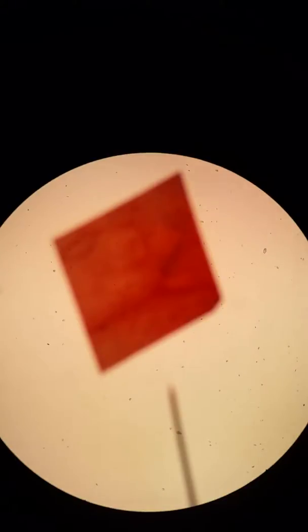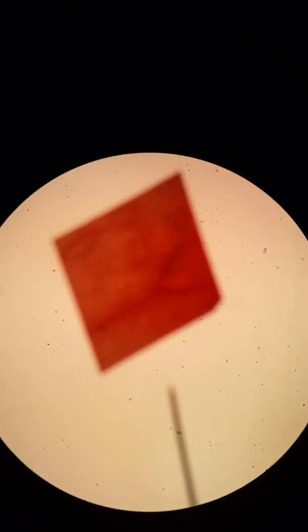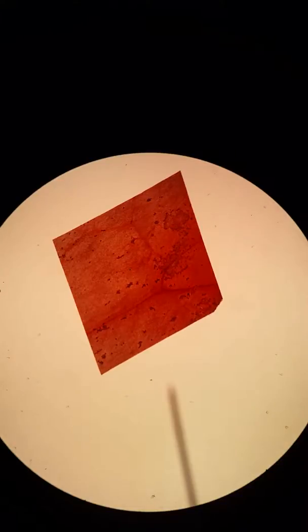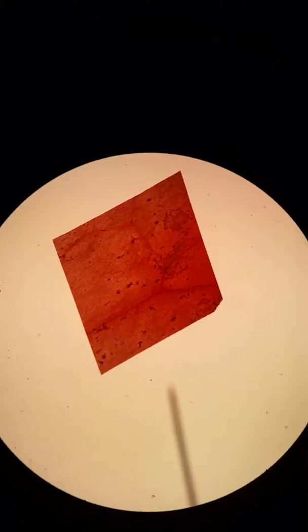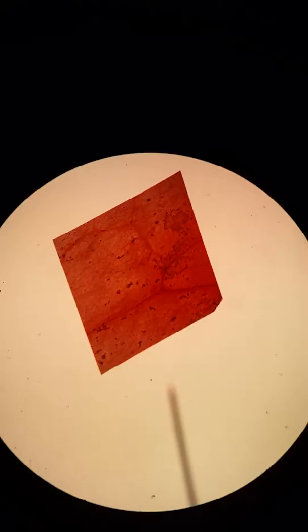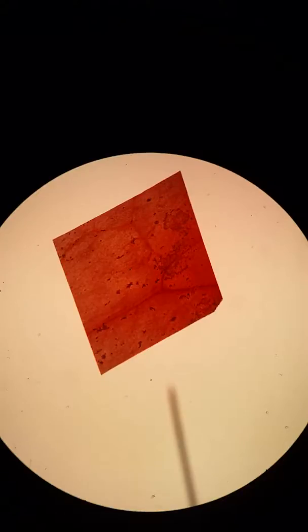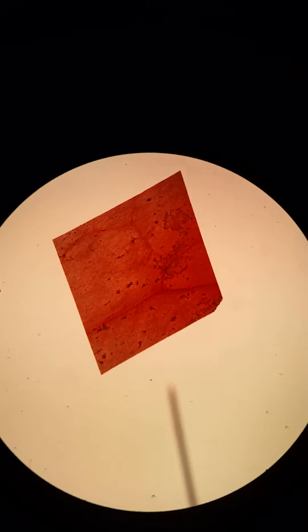This is the start of our epithelium slides that we are looking at in our lab class today. We're looking at low power at an example of simple squamous epithelium. What we've done is taken a sheet of this tissue and laid it flat on top of the slide, so you're actually going to be looking at the cells from a top-down view. On low power we're not seeing a whole lot, so we'll go up to medium power.